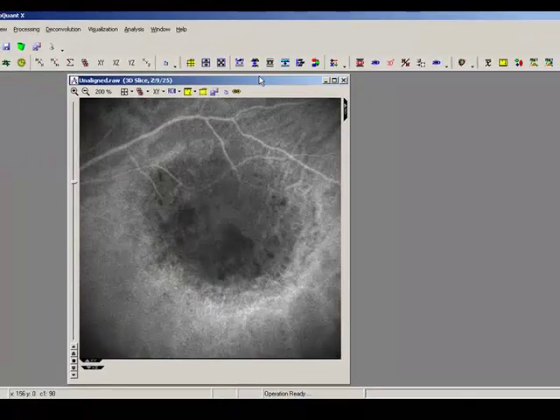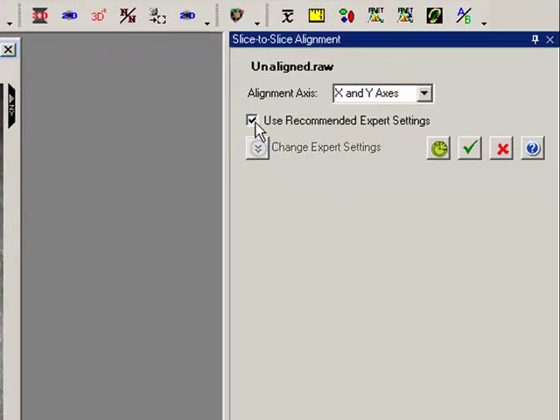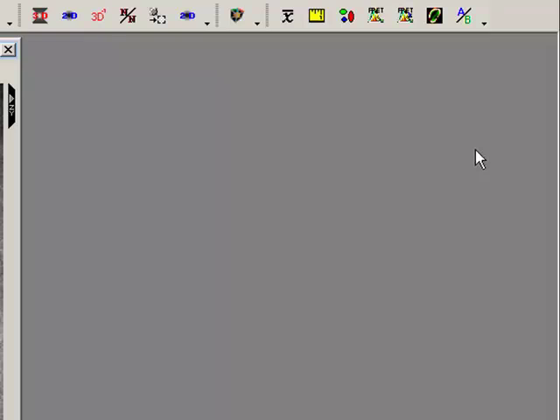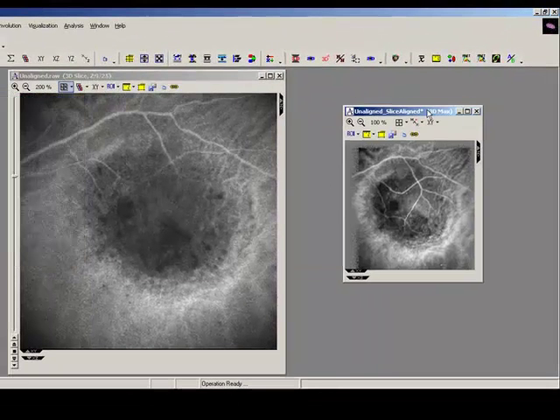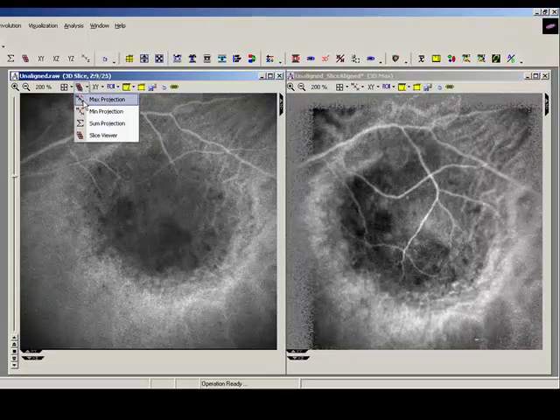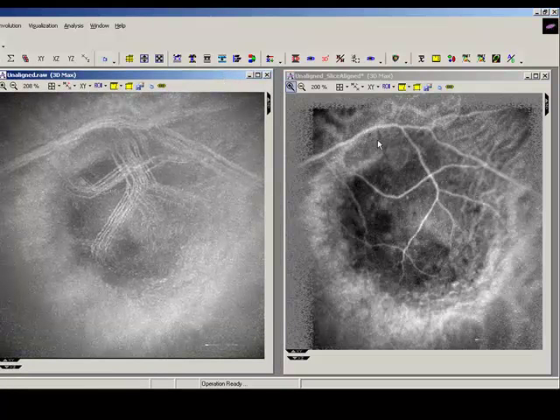Okay, so I go to the slice to slice shortcut here. Firstly, I'm going to just use the recommended expert settings, making the alignment both in X and Y direction, and launch and see what we get. Okay, so here's the aligned image. Firstly, let's just compare maximum intensity projections here. Now we can see clearly on this aligned image on the right, we've got a much better projection here. This is a bit of a nonsense projection, really. That's caused by the images being so badly aligned. We couldn't get a good maximum projection.